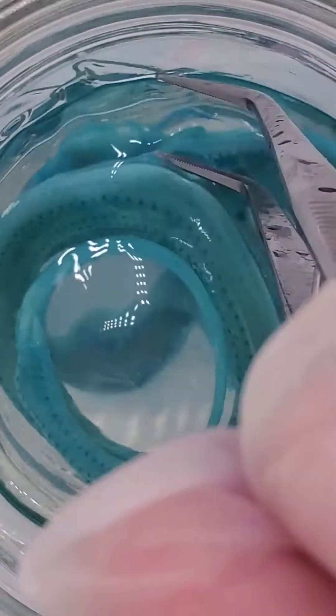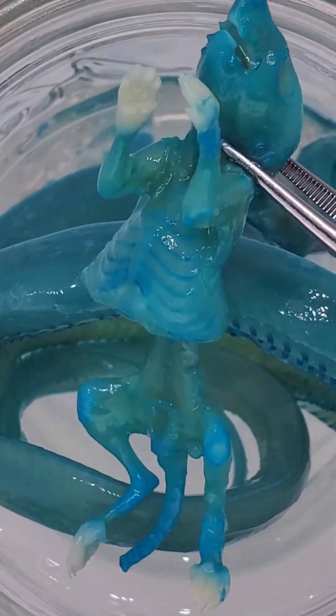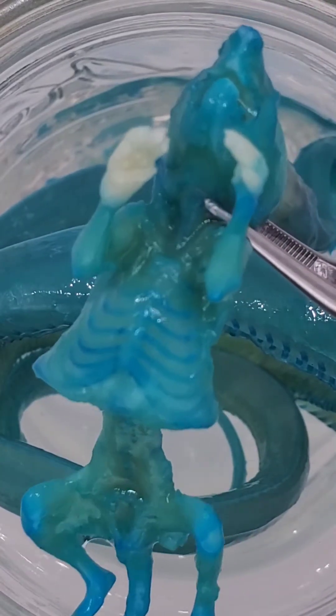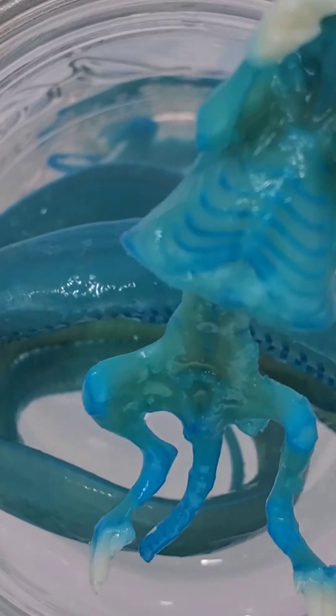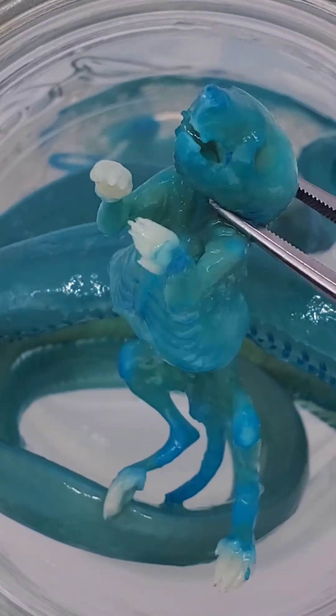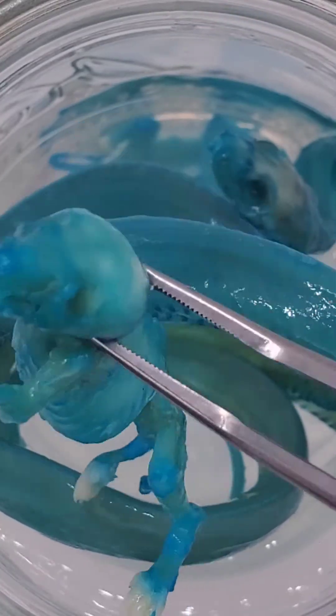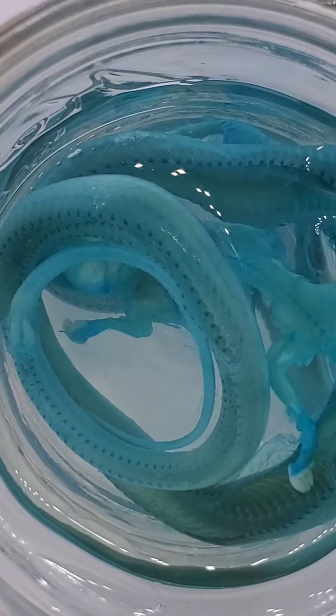All right, let's find a mouse. And here you can see where the cartilage stain took right at the tips of his ribs also and his tail as well as his knees and other joints and the tip of his nose. You can see that they're still kind of milky or opaque.